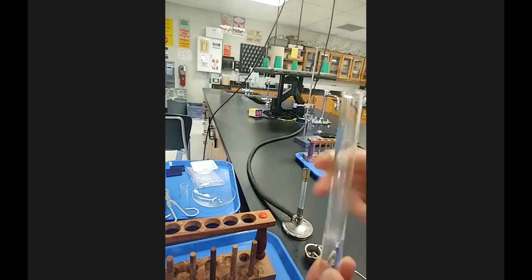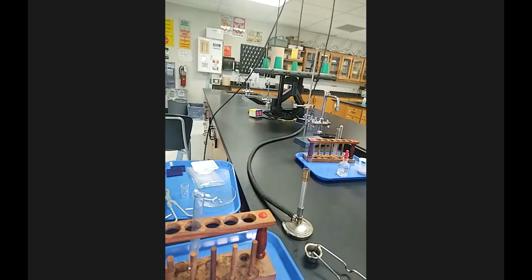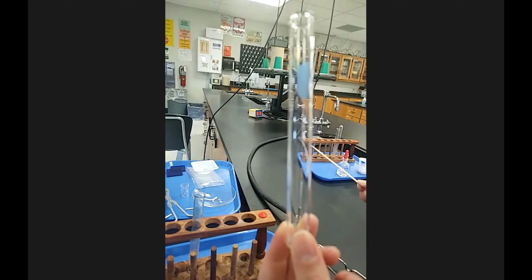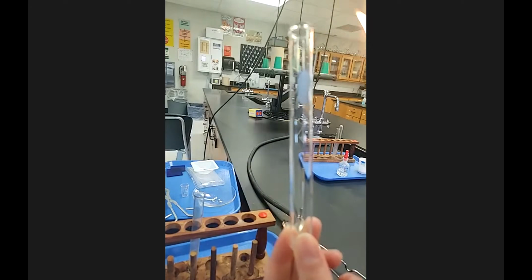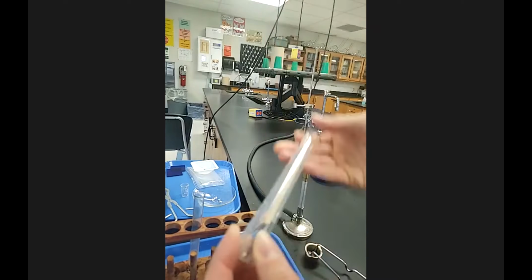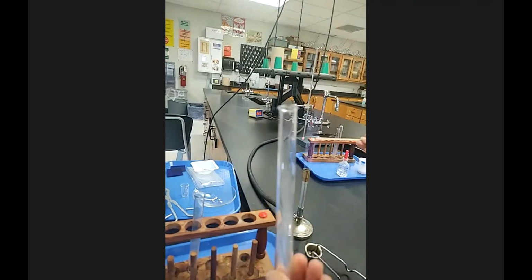And it's also for comparison purposes, what happens if I put a glowing splint in a test tube that has nothing in it? Let me grab a clean test tube over here. So, right, you need to know what does a glowing splint do in a test tube that has nothing in it to know if what I just did is unusual or, you know, typical. So, burn the splint, blow it down so it's glowing, put it in. Oh, shoot, dropped it. Let me do it again.